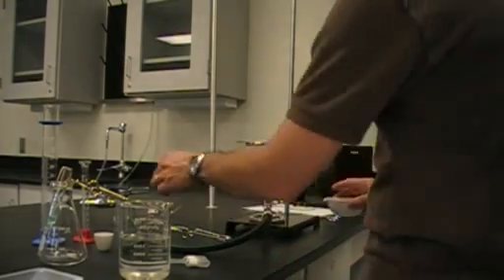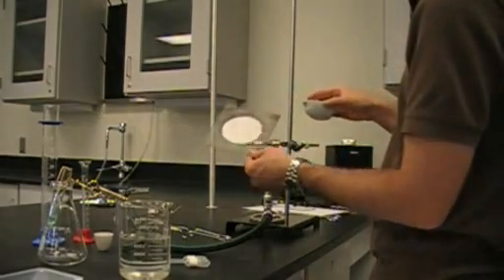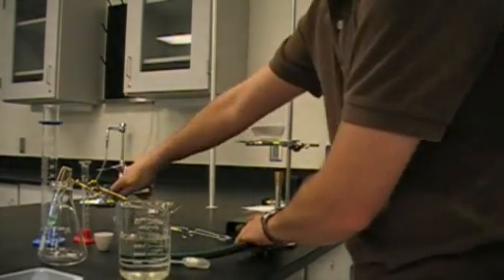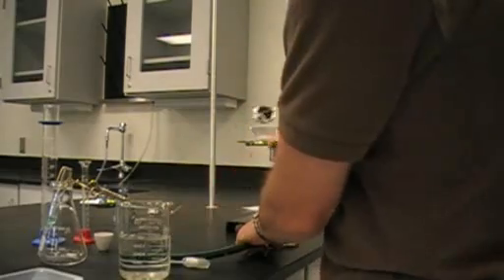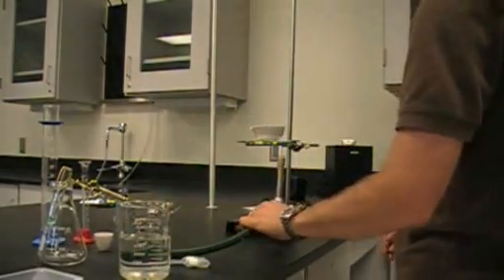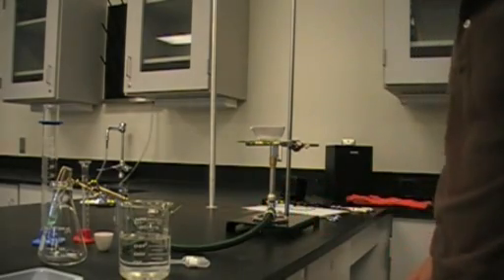And really what we are going to do is set the evaporating dish on top. Again, we are using the wire gauze, the wire ring. And we are just going to get the heat going. Once again, we are going to heat that up.